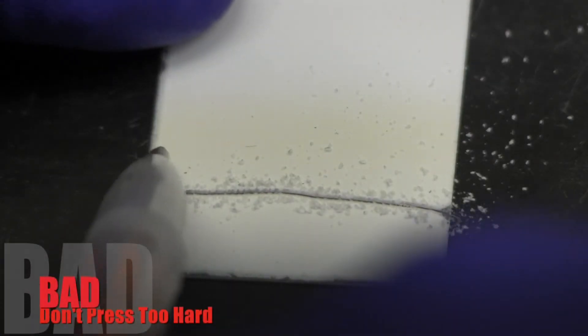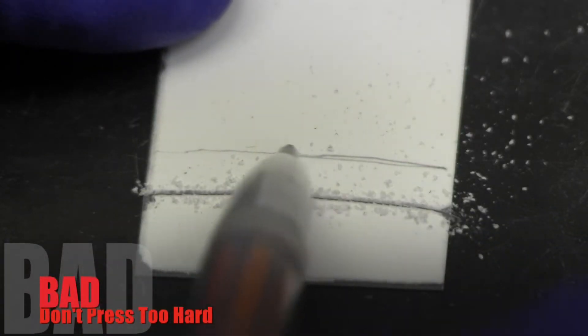Locate the bag of TLC plates. Be gentle when handling the plates, or you will scratch off the white silica surface.